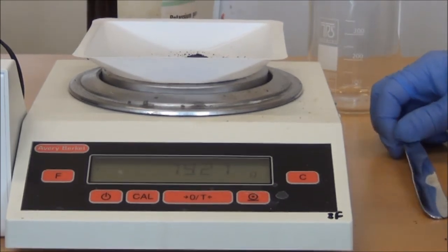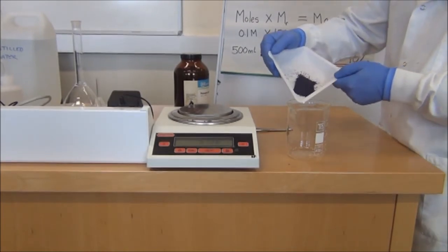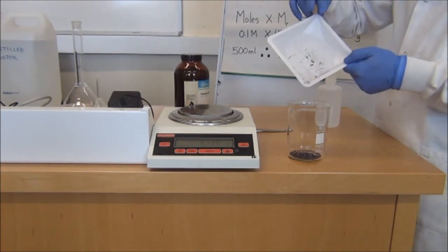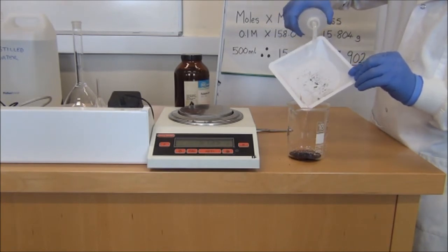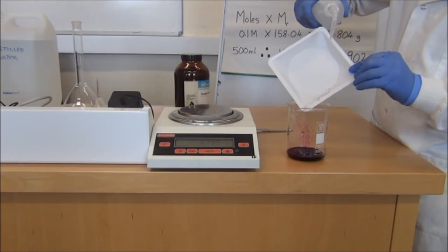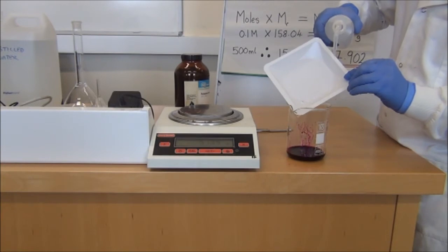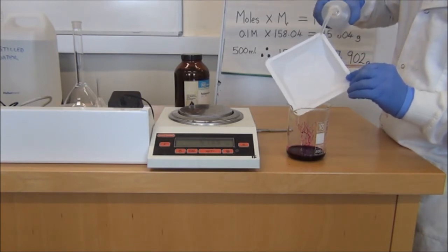And the next step is to transfer into the beaker. So we do that as carefully as possible. And we've used potassium permanganate in this example because it's dark purple crystals, so you can easily see, and you can see some of the solid is still on the weighing boat, so we use distilled water. This will all add up to the final volume, but for the washing step it's fine. The advantage of potassium permanganate is that it's very easy to see whether all of the solid has been rinsed because of the purple solution, but of course with your solution it may not be as easy, so you just have to be as careful as possible.